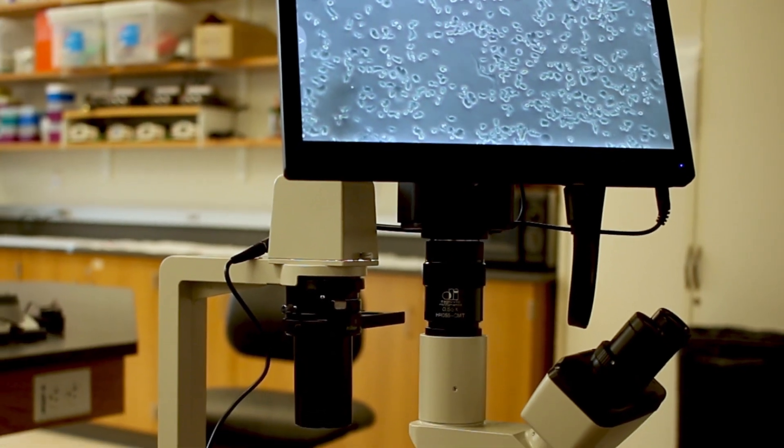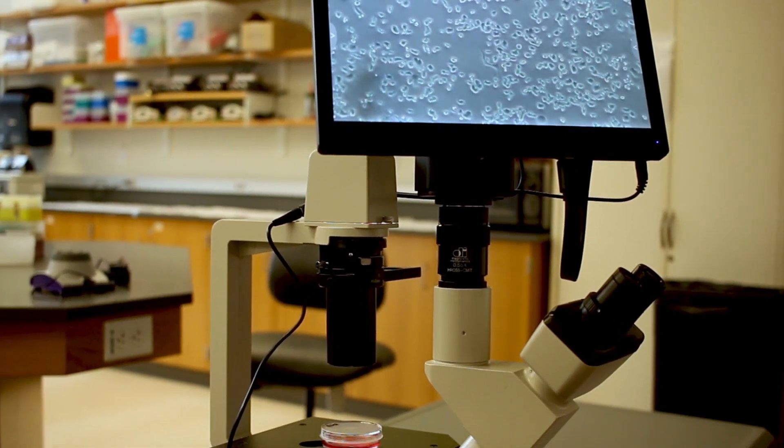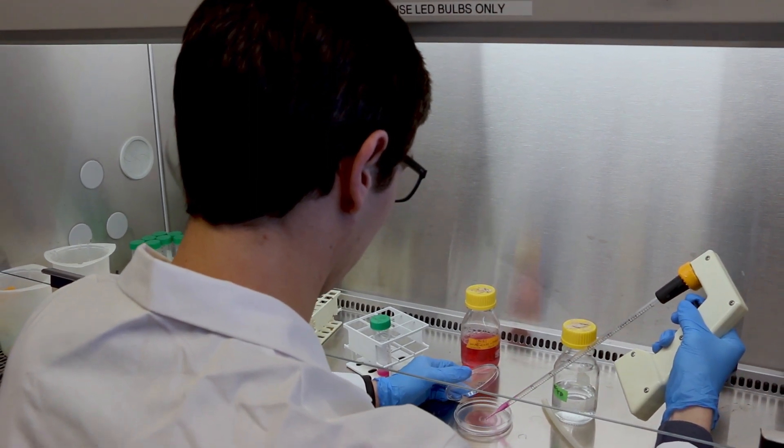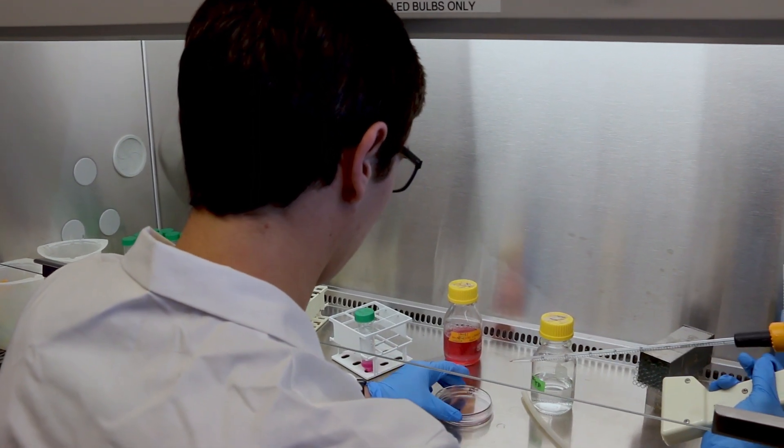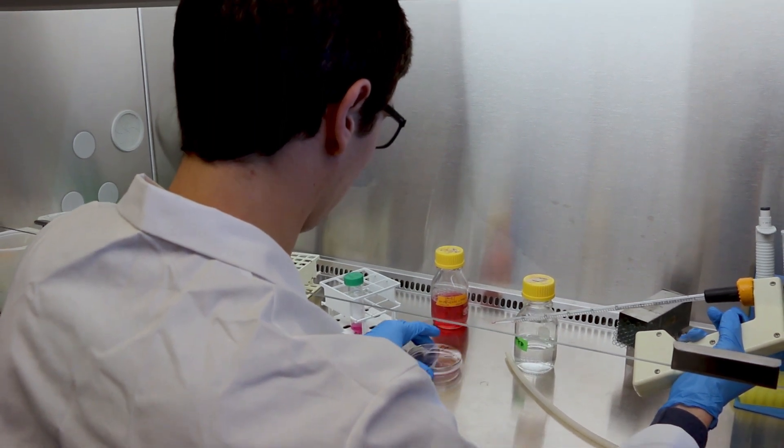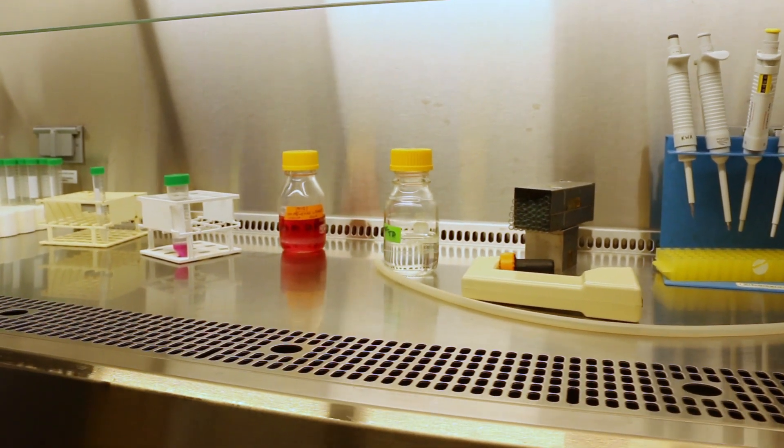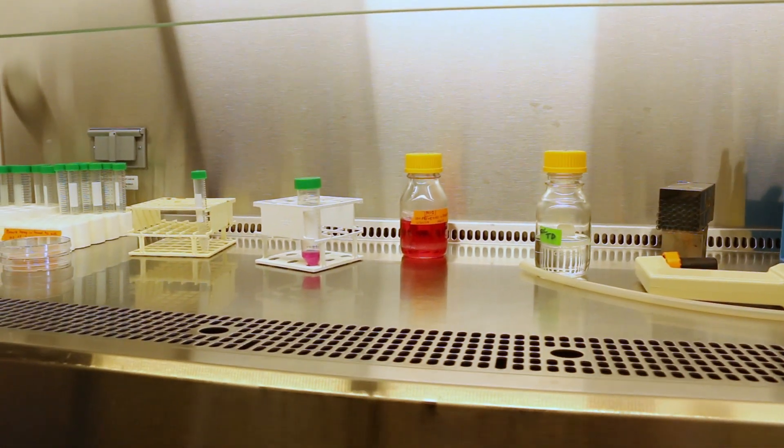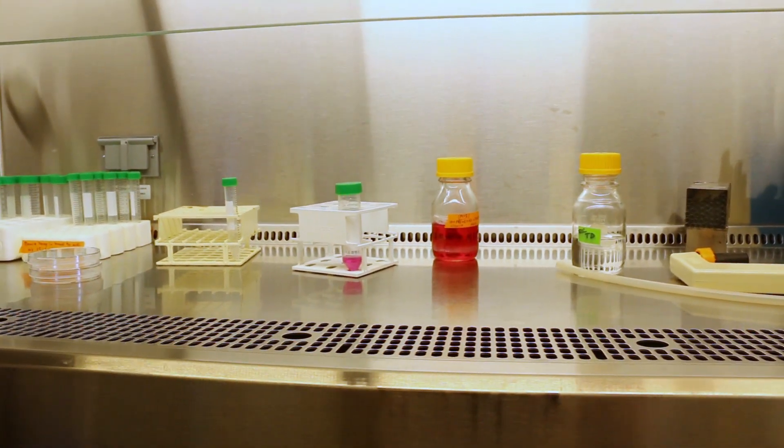Now you've seen the cells look good. Let's begin the experiment. For cell culture work that requires extensive handling and longer incubation, we should use a cell culture hood. But for this experiment, since your cells will be harvested and lysed immediately after the five-minute treatment, you can just do the experiment on your bench.